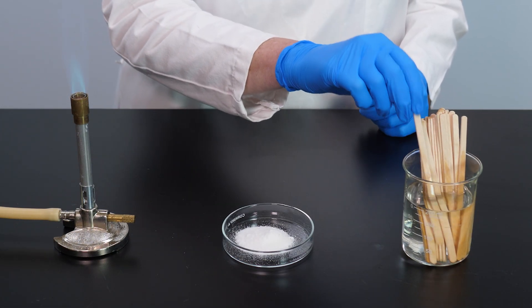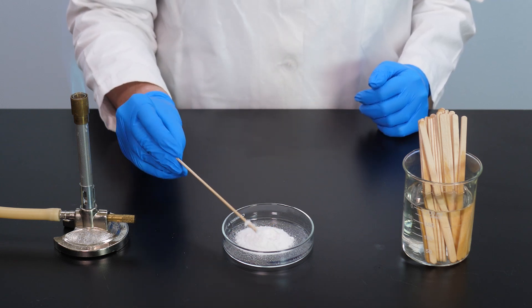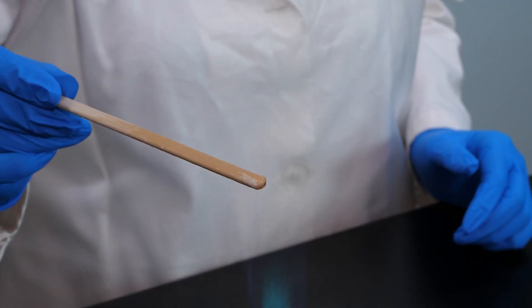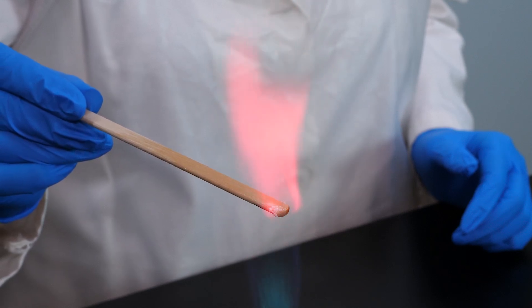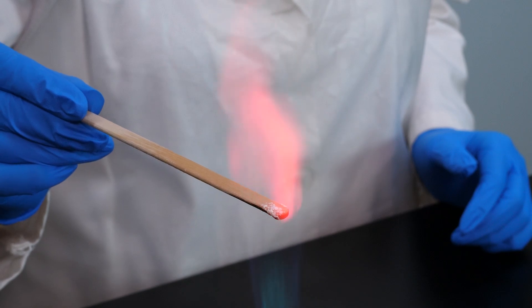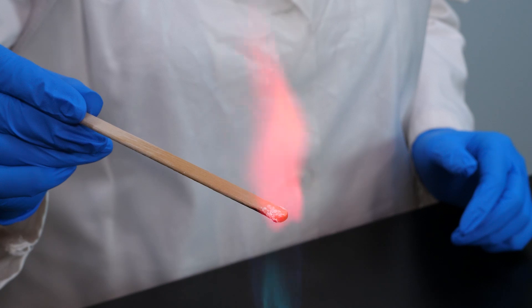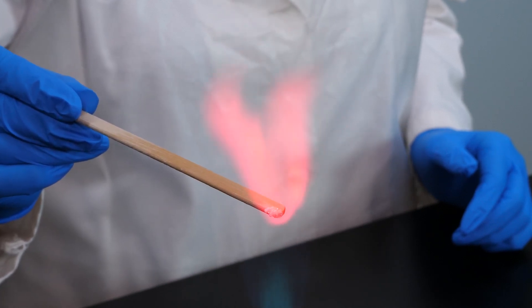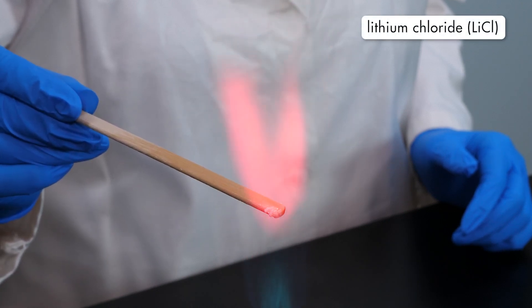To hold a sample of a compound in the flame, we use a wood splint that has been soaked in water and dip it in the compound. We see that the compound burns with a bright red color. Compounds containing lithium or strontium burn with a bright red color, so we suspect this compound contains one of those metals. Further investigation reveals that this is lithium chloride, and our flame test confirms its identity.